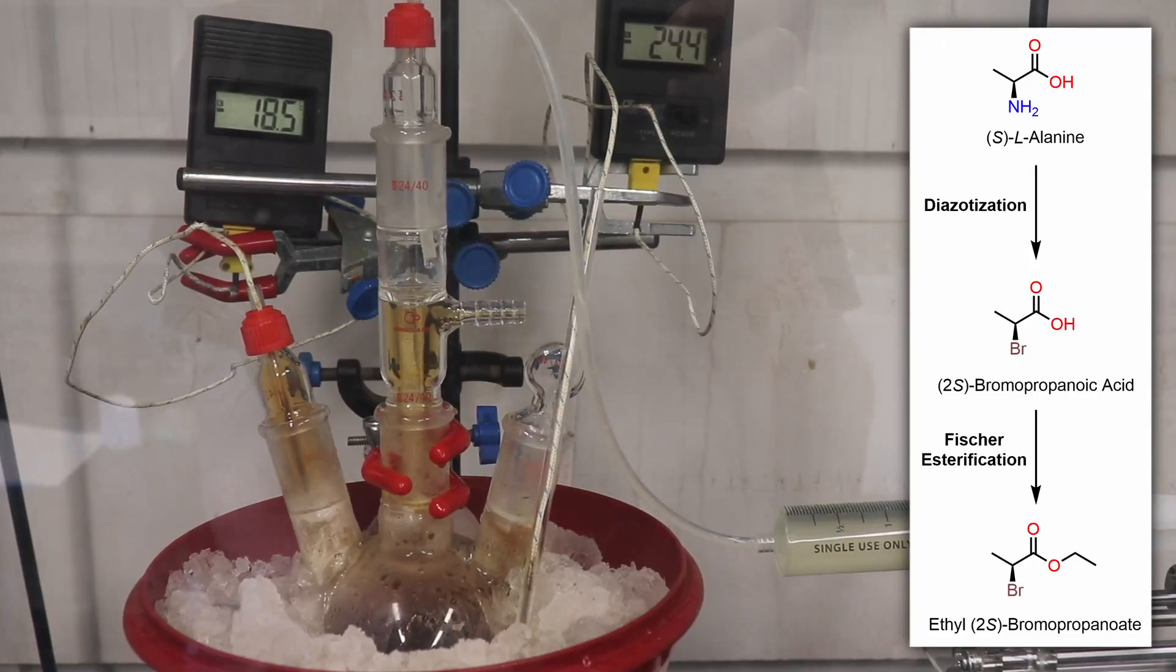Welcome back to the lab. In today's video, I'll be showcasing the synthesis of 2-bromopropanoic acid and ethyl-2-bromopropionate, starting from the amino acid alanine.